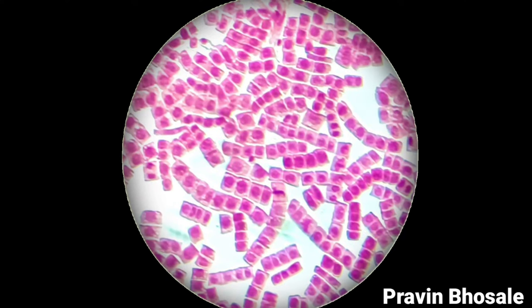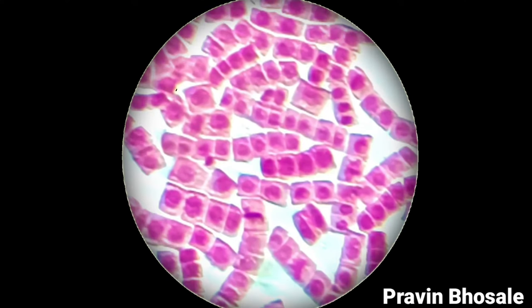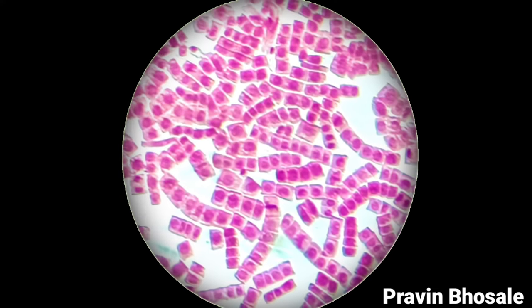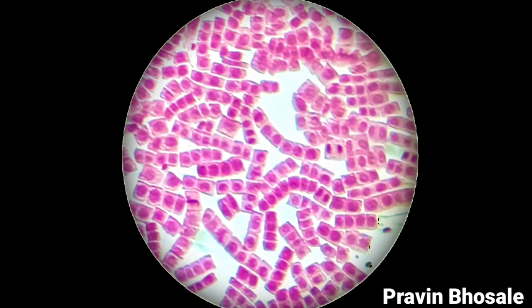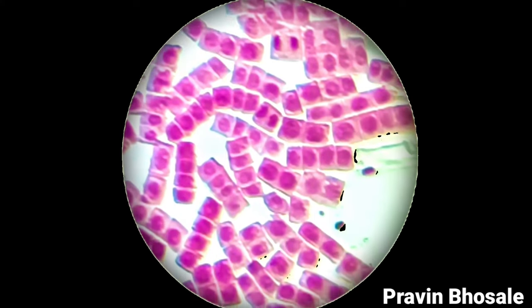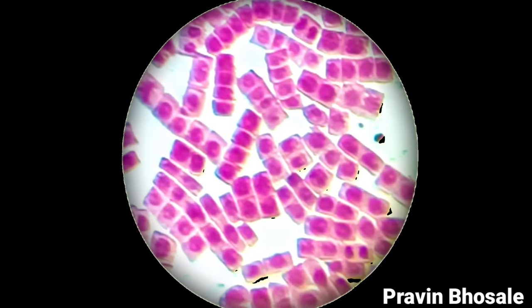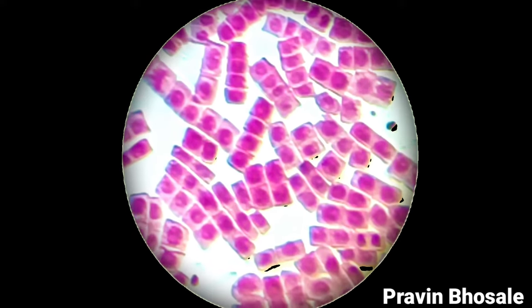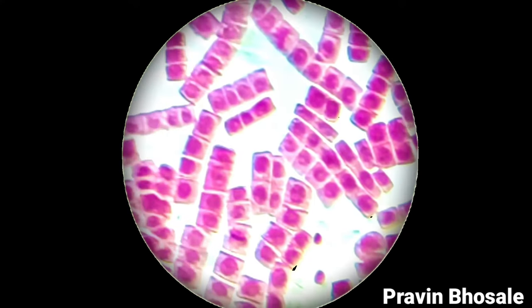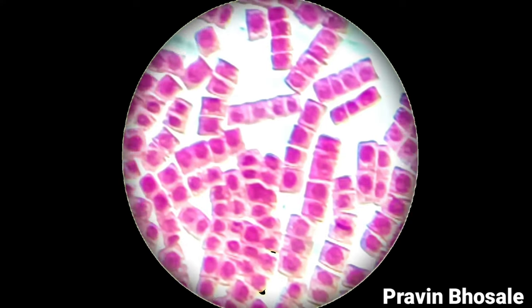This is the slide of mitosis. Mitosis is seen in square-shaped cells. If the cells are elongated and rectangular, you are observing interphase. So just go through the stages and try to identify them — later on I will tell you how to identify the stages.